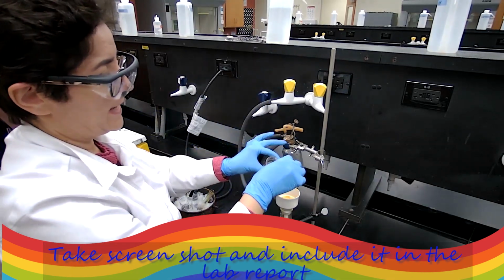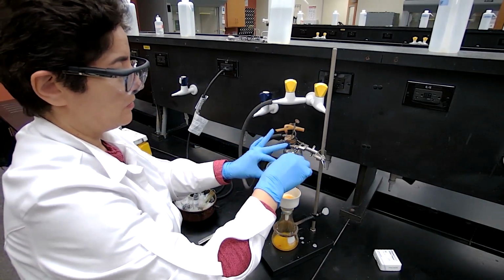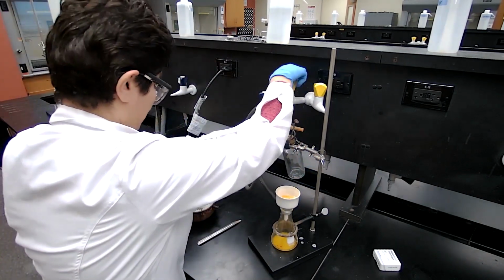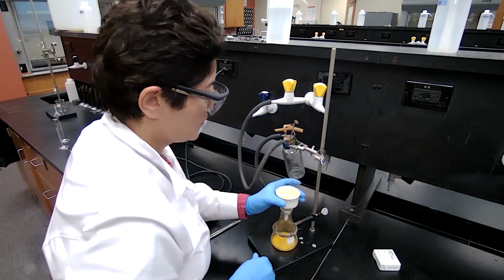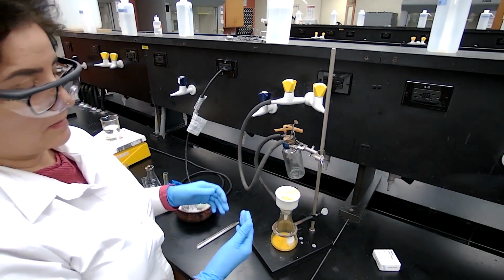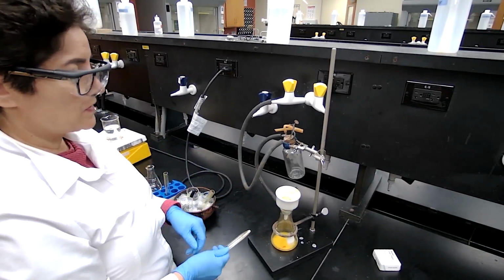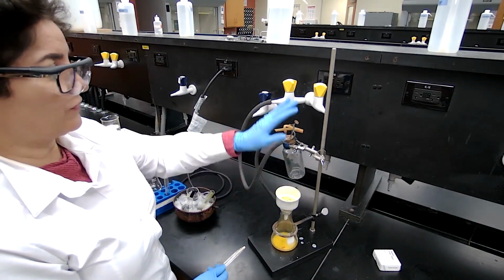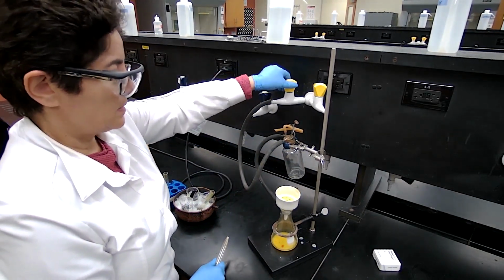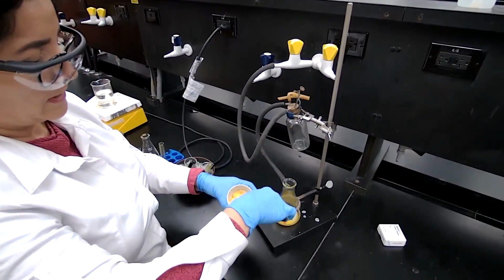Close the vacuum. I add the washing solution, which in this case is water, and then I turn on the vacuum. Because it's very important for me to make sure the product is pure, I'm using recrystallization. And because it's going through recrystallization, I don't have to wait for 5 extra minutes for the sample to dry completely. So I would just remove it and transfer it to an Erlenmeyer flask for recrystallization.